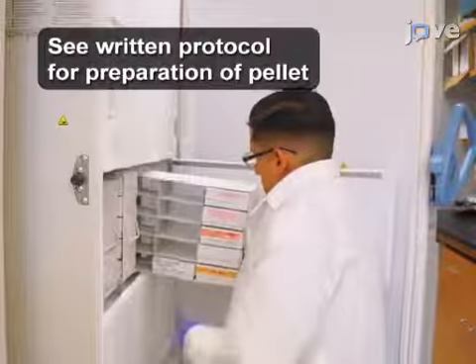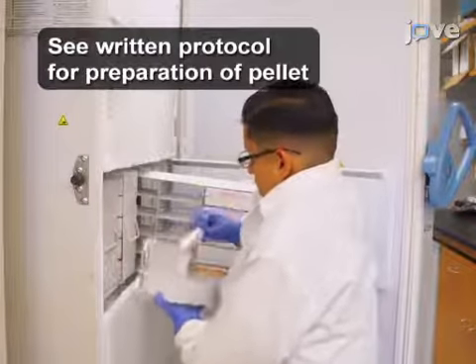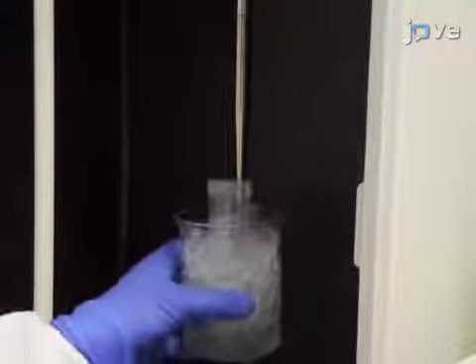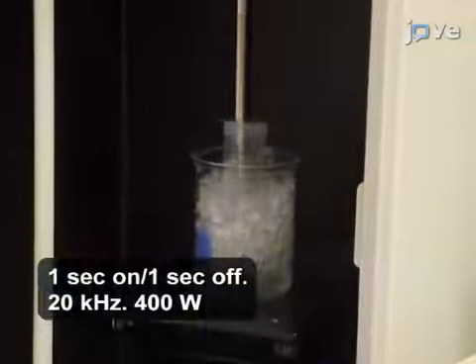Begin by thawing 1 pellet of E. coli-expressing prototype Foamy virus integrase on ice. Use a sonicator equipped with a 0.5-inch diameter biohorn with a 0.125-inch diameter tapered microtip to sonicate for 30 seconds at 30% amplitude with the tube on ice.